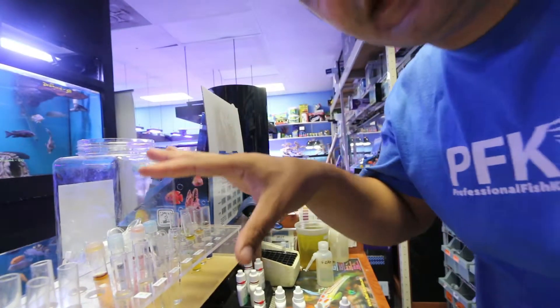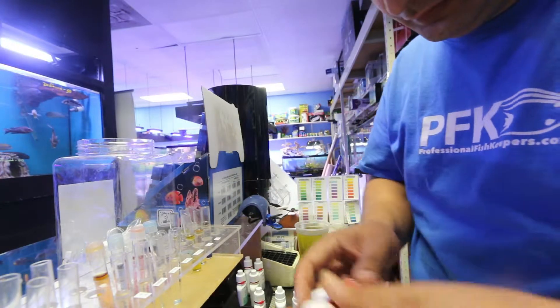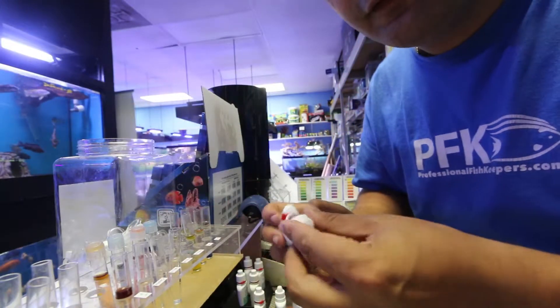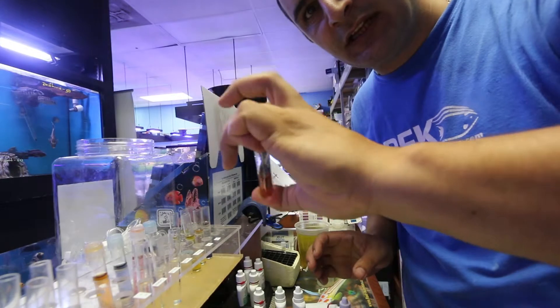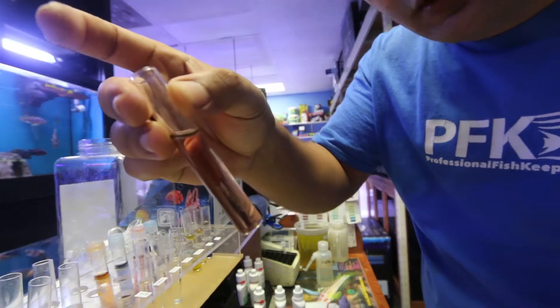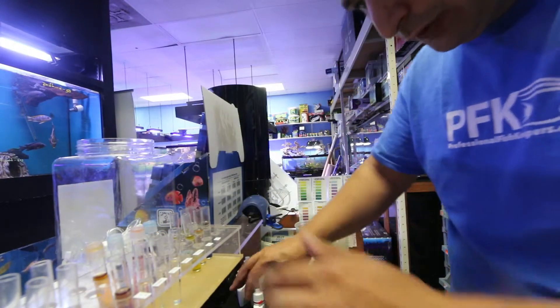These are some other tests we did yesterday that I didn't have time to clean. For the pH test, add five drops, then shake the tube up and down. The pH color here shows about 8.0.